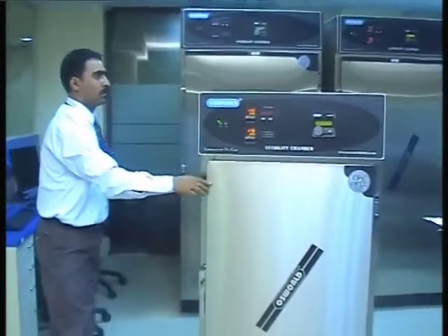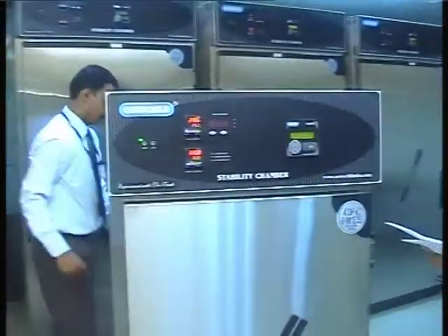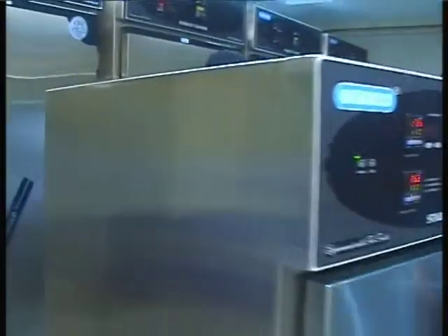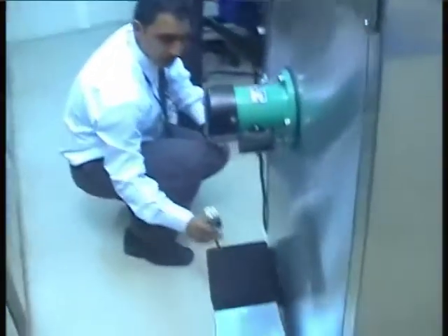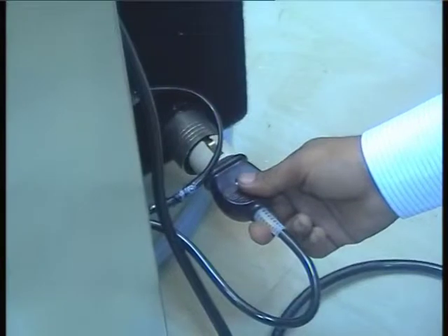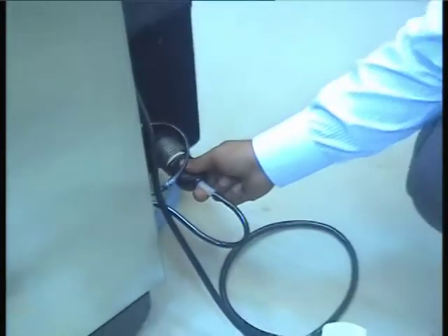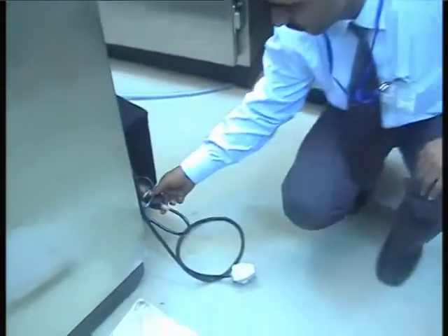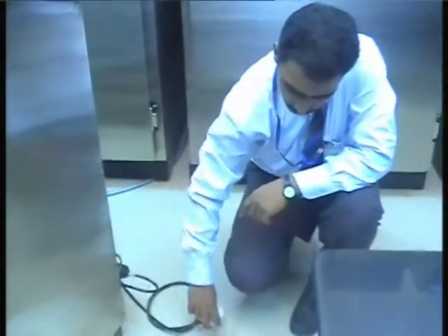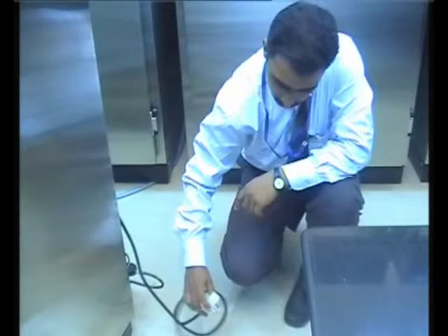Connect the steam generator heater to the socket mounted behind the equipment. Connect the mains plug to a 230 volts AC supply source.